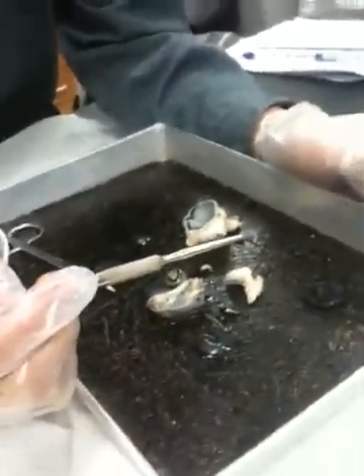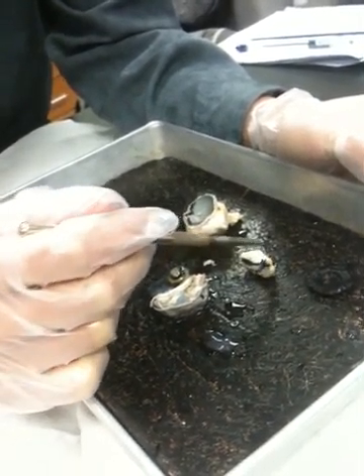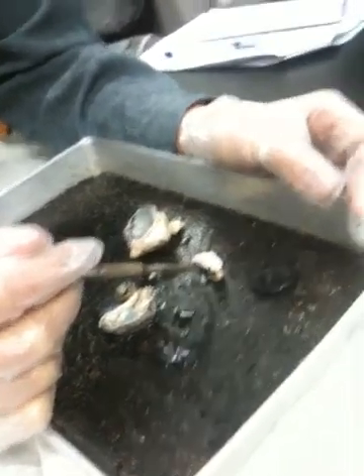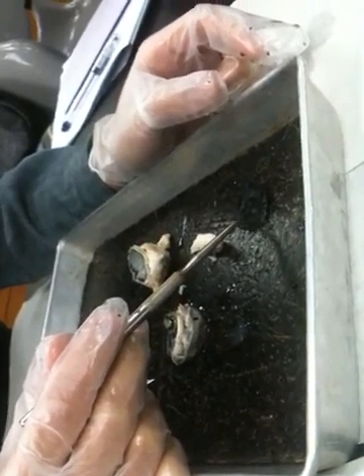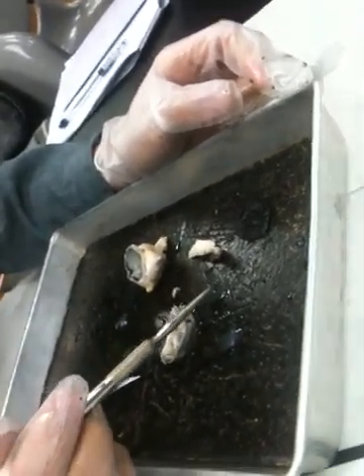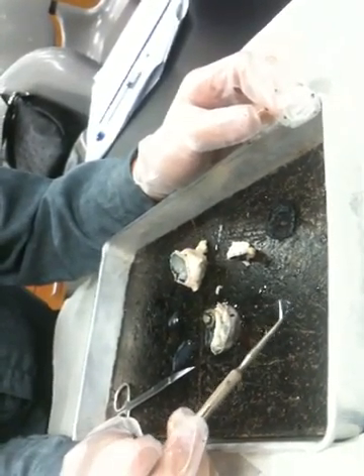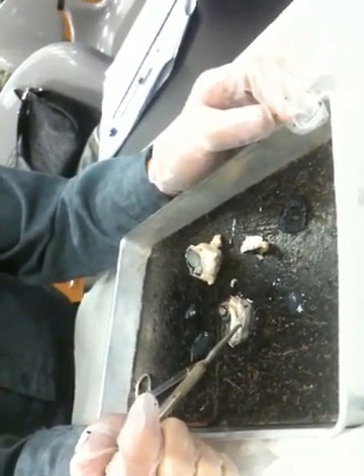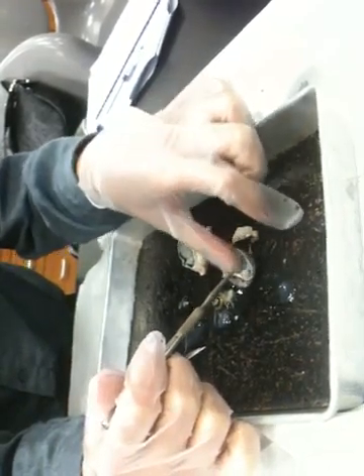What we can see from this backside view, we're still looking at it from where the lens would be in position. So hopefully you can see along the edges of the opening there's the pupil. You can see these ridges. These represent the ciliary muscles. They're part of the ciliary body. So the ciliary body would be the ciliary muscles or ciliary processes here, along with the suspensory ligaments, which hold the lens in place. So normally the lens would be sort of right there behind that opening and held in place by the suspensory ligament.